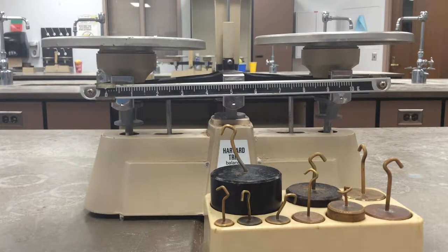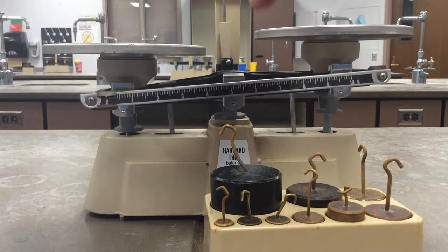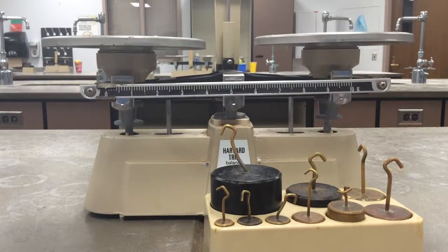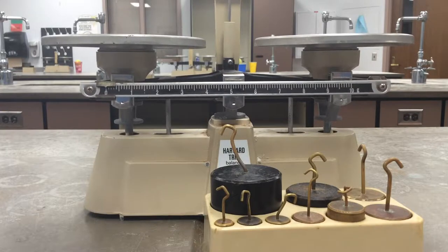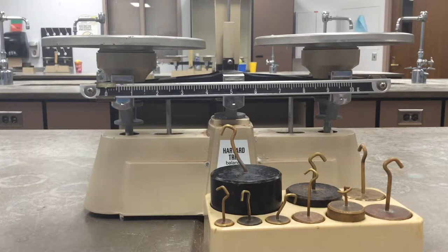All right, welcome to our first lab in the back lab room. Today we're going to be using the double pan balance. These are the balances that we will be using. We'll have electronic ones we'll use later in the year, but this will be the one that you need to become familiar with.